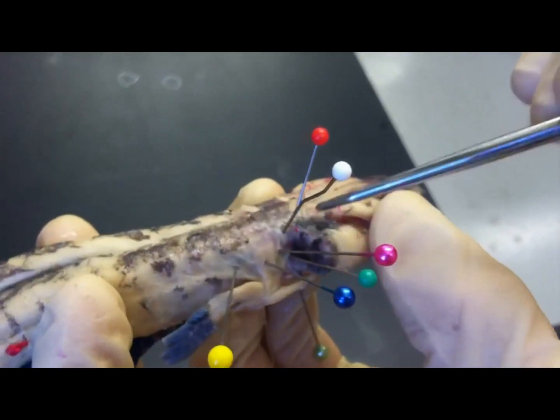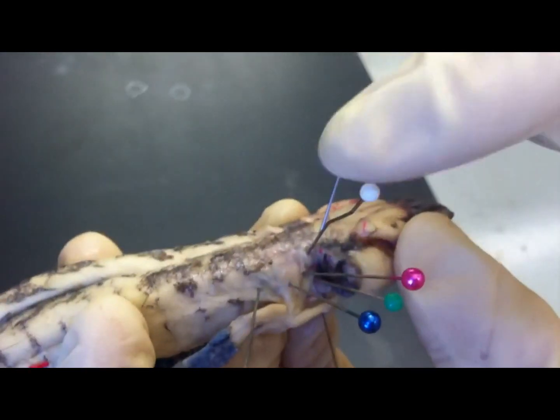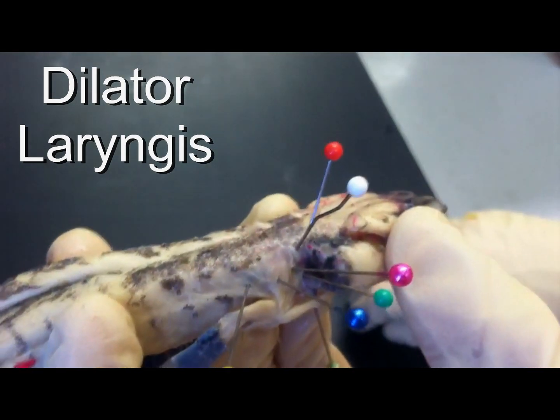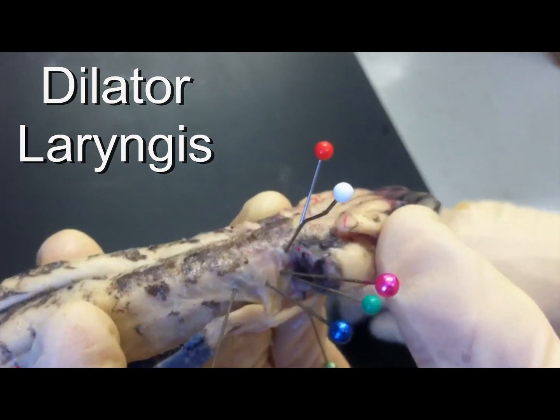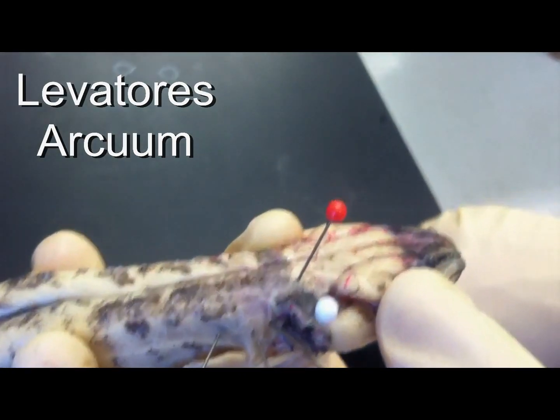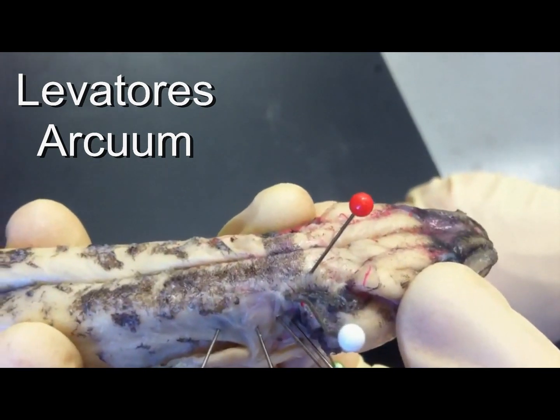And then we have two on the dorsal side. The white one is dilator laryngis, and the red one is levator arcuum.